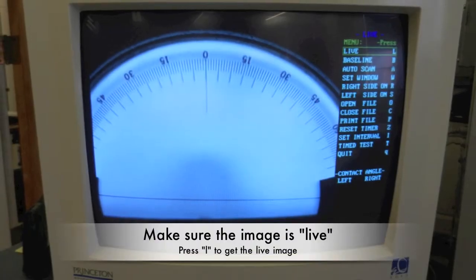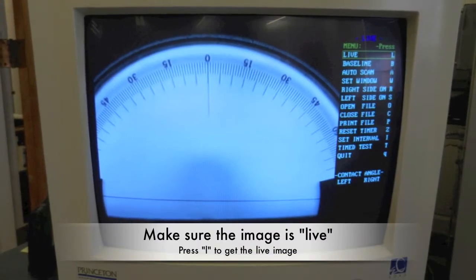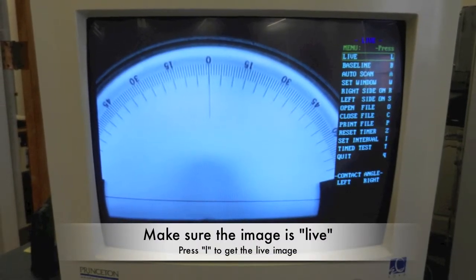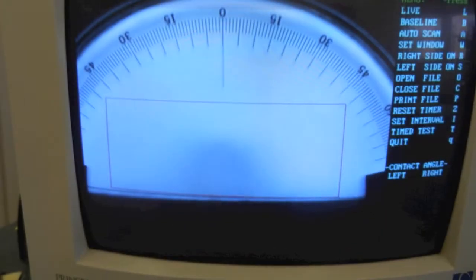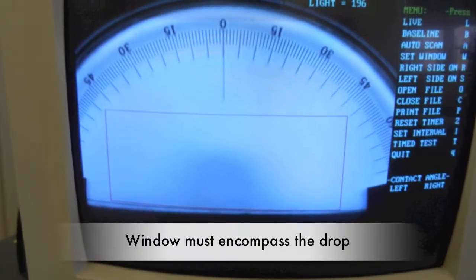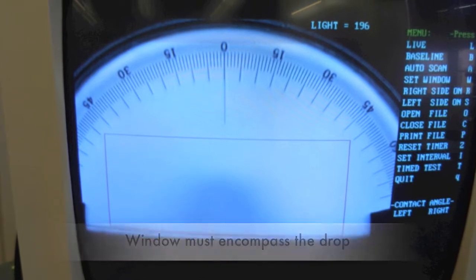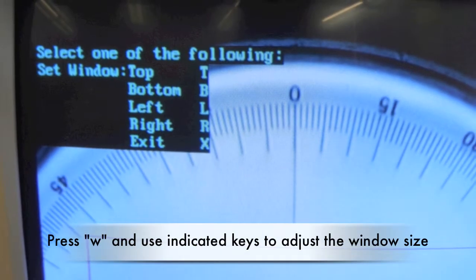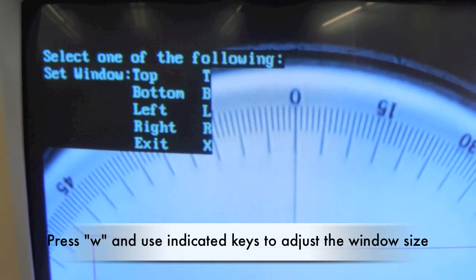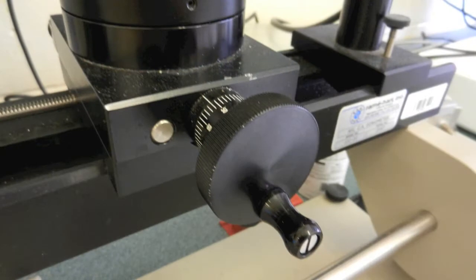Make sure the image is live as indicated in blue at the top of the screen. Press L to get to the live image while making adjustments. The window on the screen must encompass the drop to get accurate measurements. Adjust the window by hitting W and use the indicated keys to adjust the size of the window.